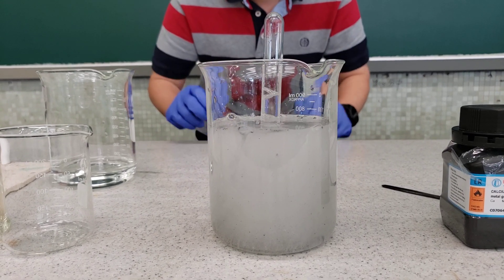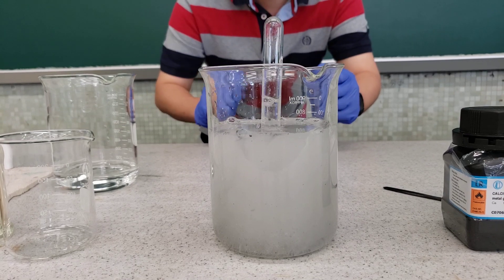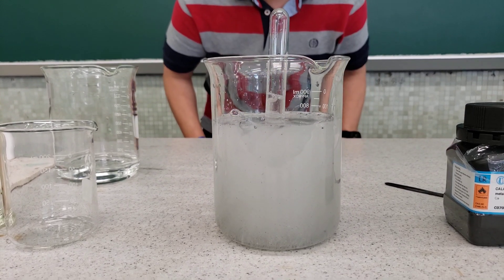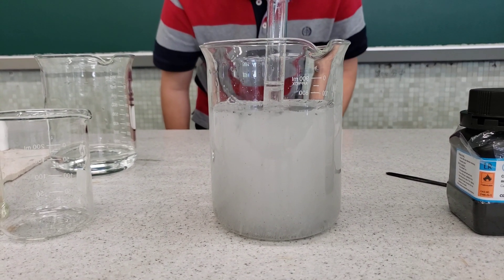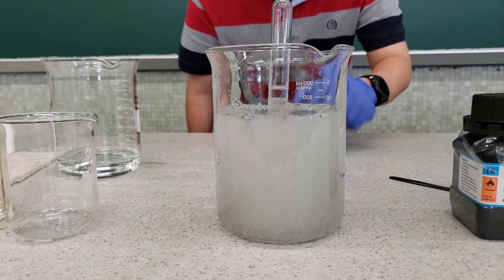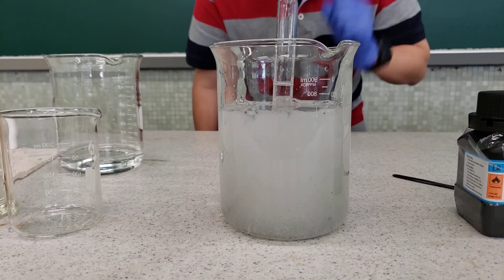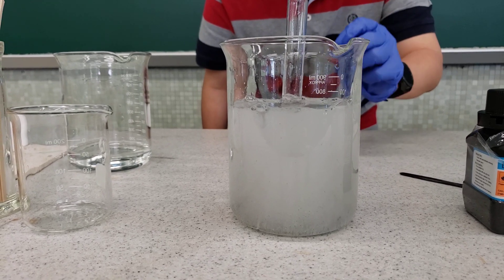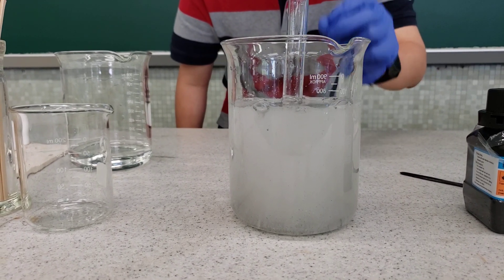Did you find that the calcium granules are basically found at the bottom of the beaker? Why? It is because group 2 metals have higher density than group 1 metals. Therefore they sink in the water.